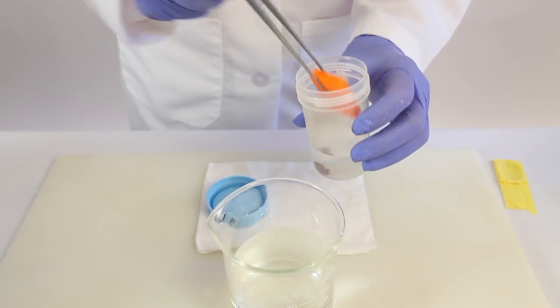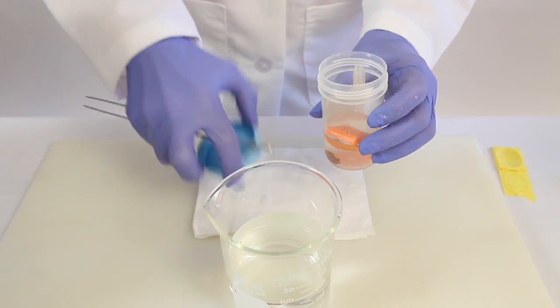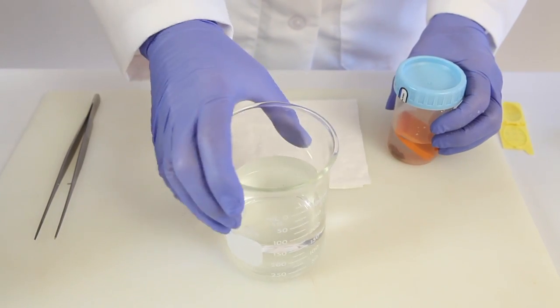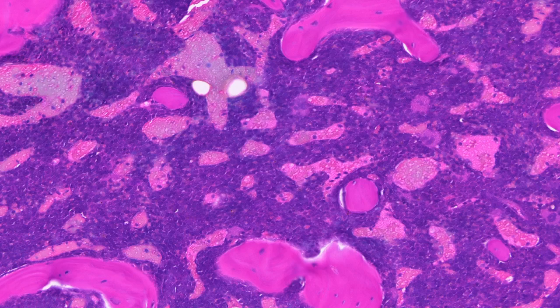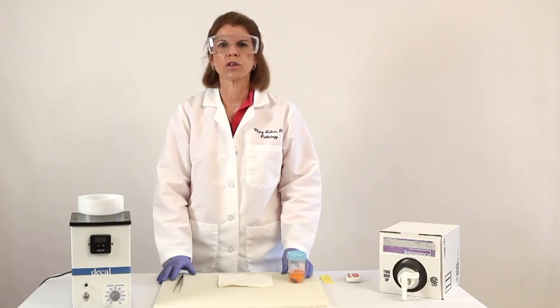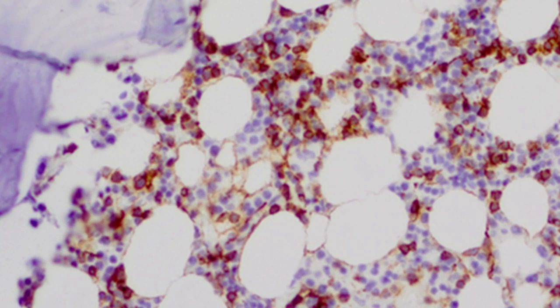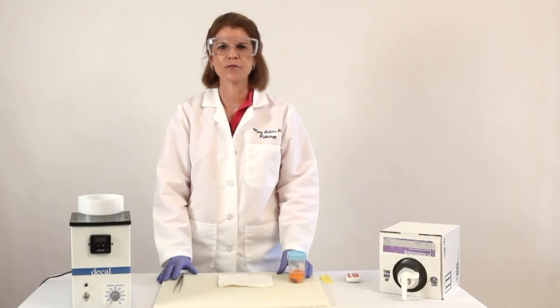Those steps take hours and hours, so you want to make sure you've decalcified properly. If you overdo it or use a harsh solution, your slides will come out murky. If you do it right, you'll get crisp nuclear detail. Your slides will be beautiful, and your pathologist will love you for it.